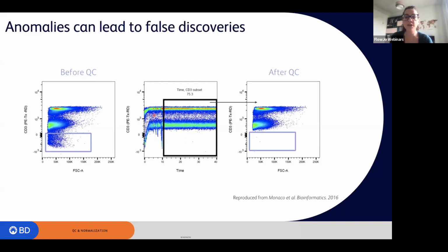So we don't want to include these kind of events within our analysis because these are not considered as reliable events. Something was wrong. So we need to exclude this area. So we do a manual gate around here, and then we move on. We realize that after QC, this population is actually gone. So this could have been an artifact if we hadn't performed any quality check or any check on our data before proceeding.